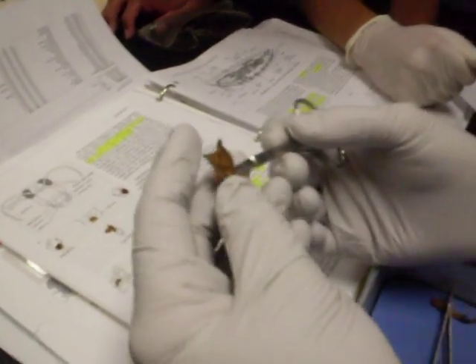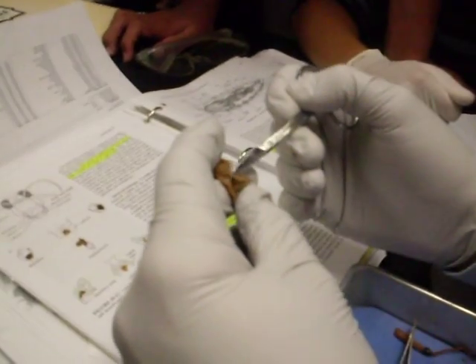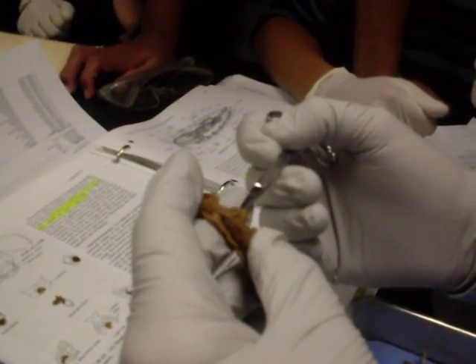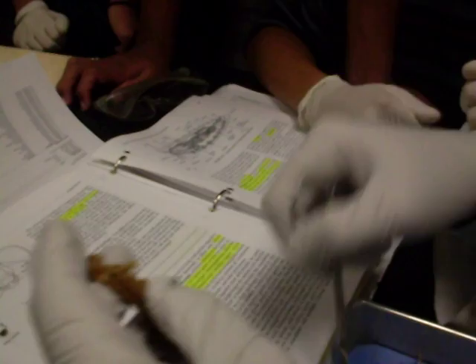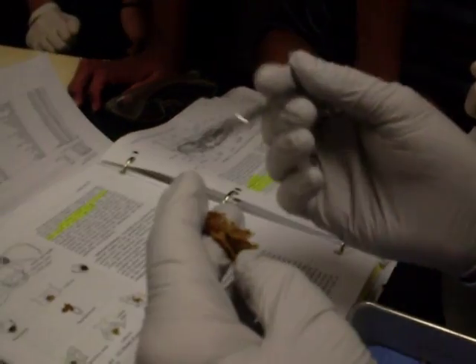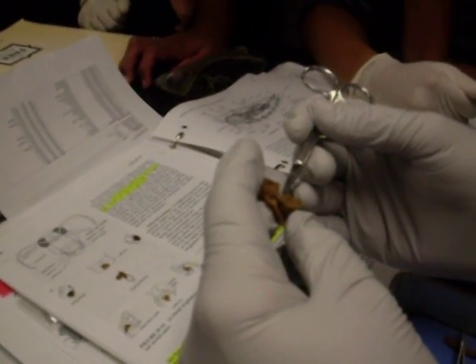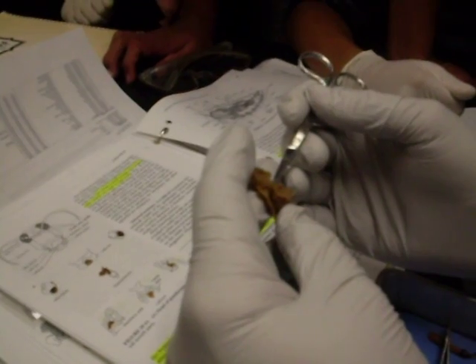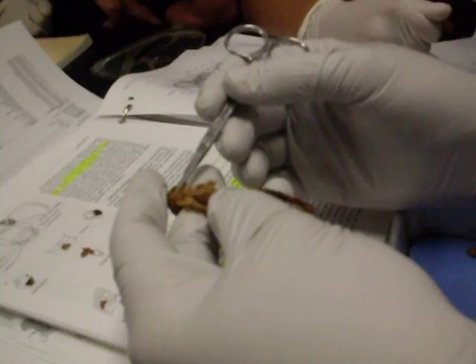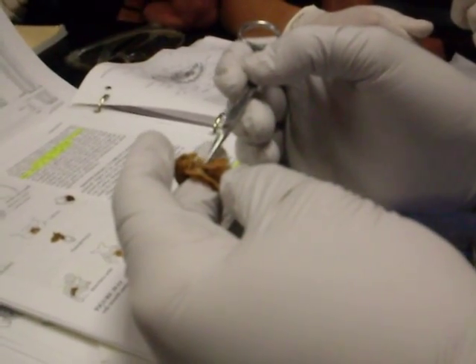See how this tapers and gets smaller? Right here. Now, what is all that stuff I'm moving away? It's all smushed. So see how much smaller that is? It's all smushed so you don't get the nice swoop-de-doo. But see how it's tapered? Everybody see that? See how it's much smaller than the colon up here? There's your sigmoid colon.